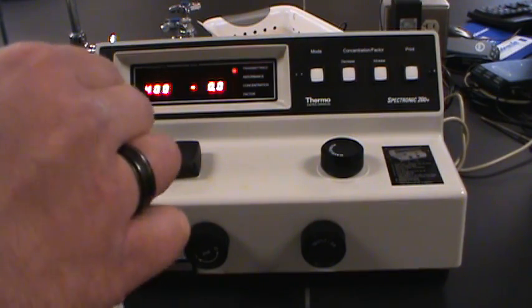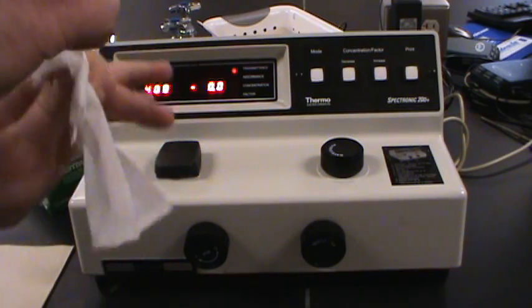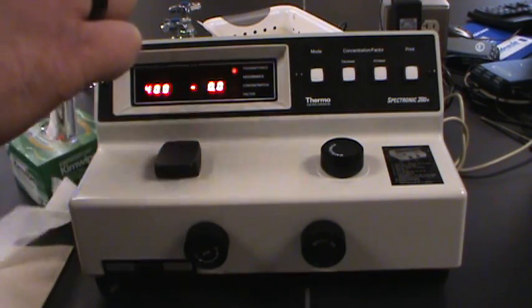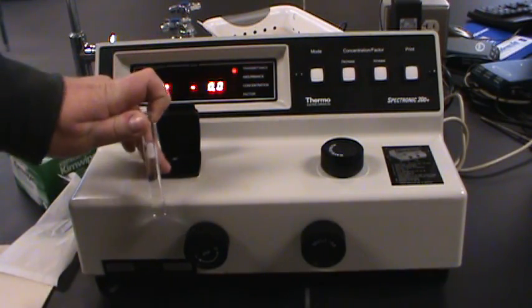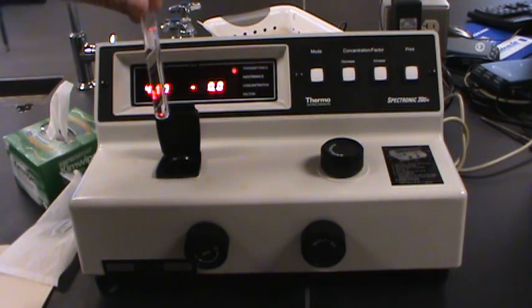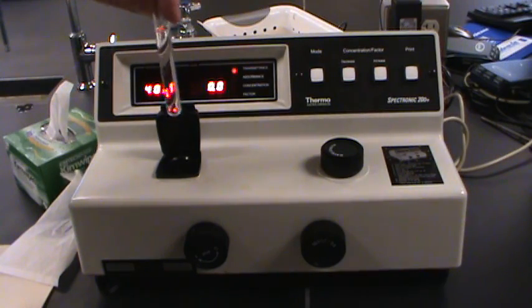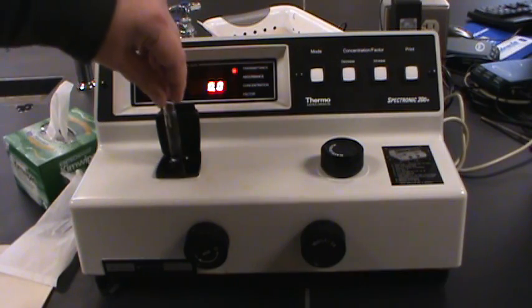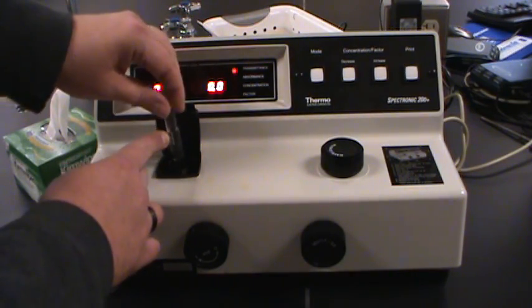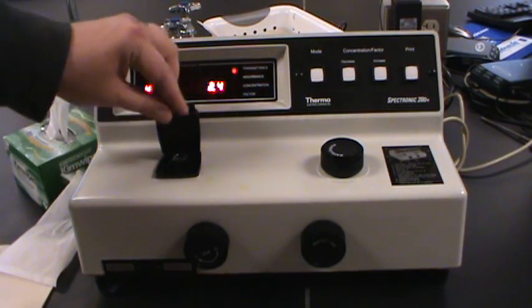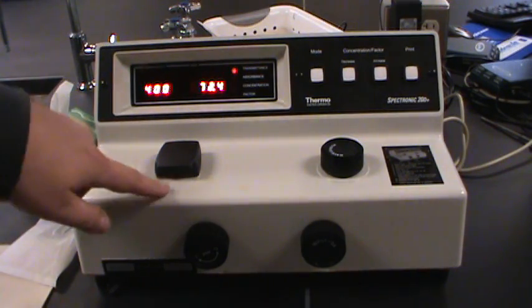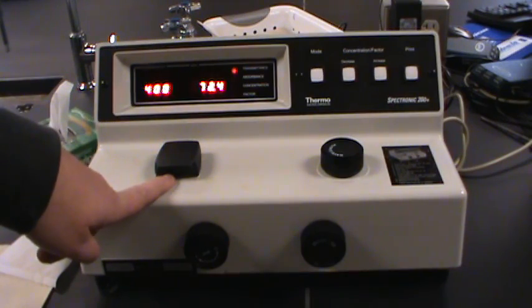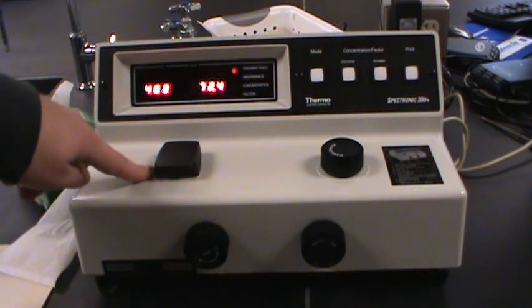Fingerprints, smudges, drops of water, everything can affect absorbance reading. So make sure you wipe off your test tube very well. And here's where that little calibration mark becomes important. We want to put our test tube in the same orientation every time. So sometimes test tubes will have a specific line on them to calibrate, but it's just as easy. If you can see the word Pyrex right here, I'm just going to slide this tube in so that the word Pyrex is lined up with that calibration line. So my sample is in. Now you may have heard a little click when the sample went in. That opened up a shutter to allow light to pass through it to get to the detector.